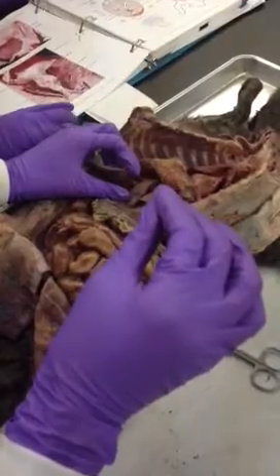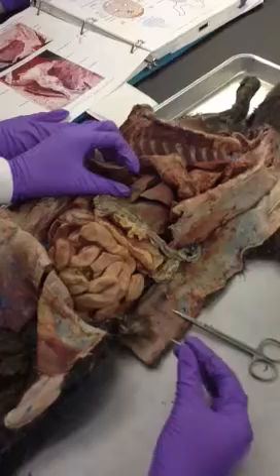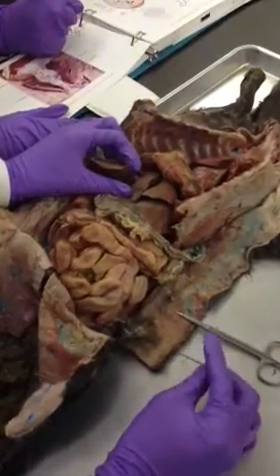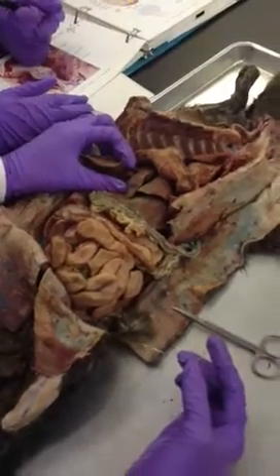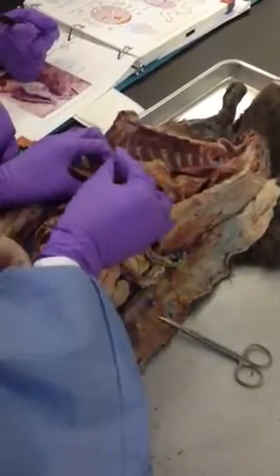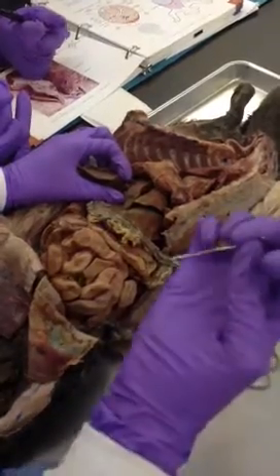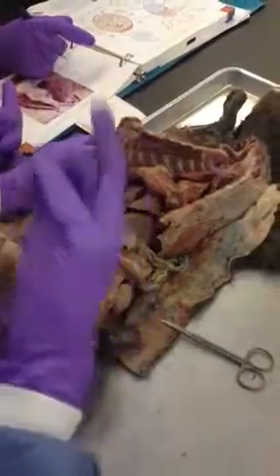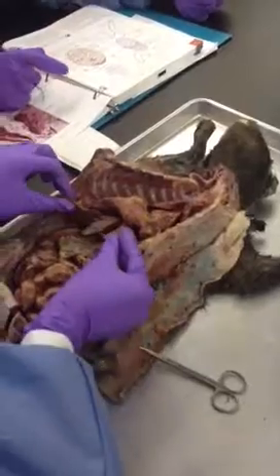So if I ask you, the area between the quadrate lobe and the right anterior lobe that holds the gallbladder is called what? Cystic fossa. Or if I say, what structure lies between the quadrate lobe and the right anterior lobe? Gallbladder. When you hear cystic, that means it's associated with the gallbladder. Cystic duct, cystic fossa, associated with gallbladder.